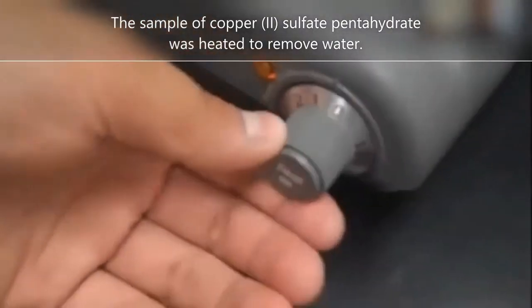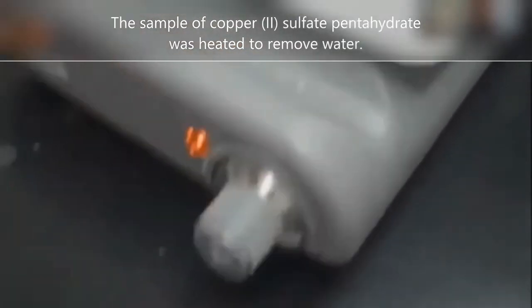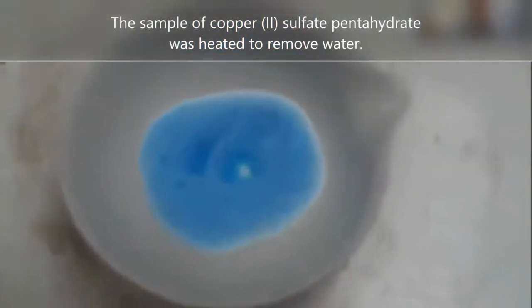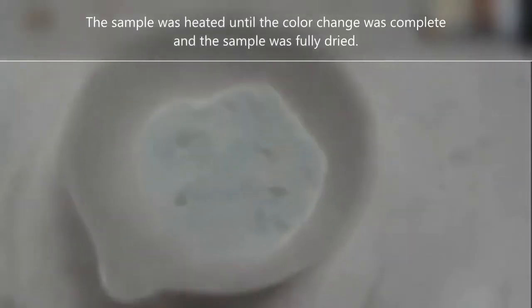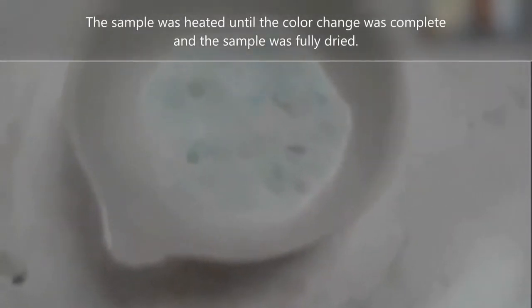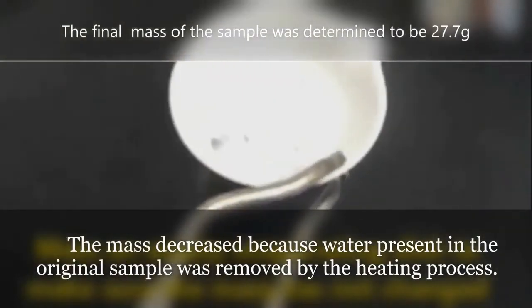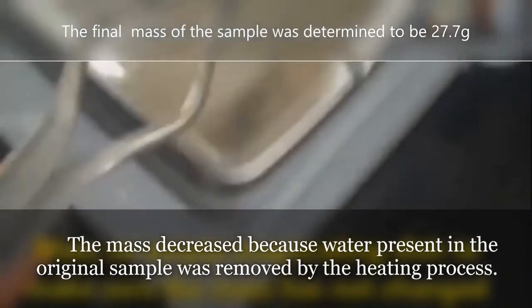Heating a hydrate causes water in the crystal structure to convert to steam, which dries the salt sample. As copper sulfate is heated, its color changes from a dark blue to a much lighter color as the sample dries. The resulting material is called an anhydrous salt or anhydrate and takes on a powdery appearance.